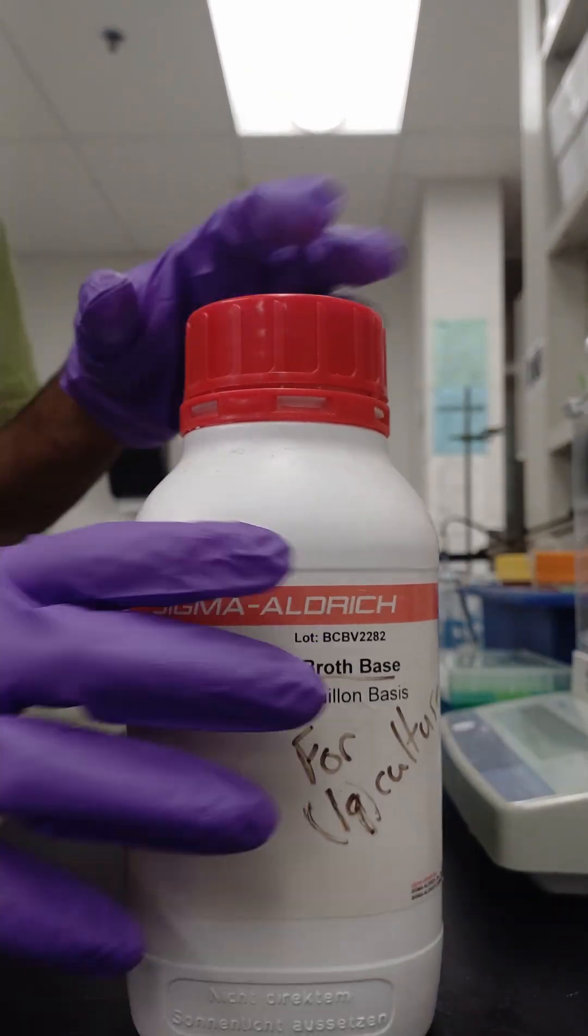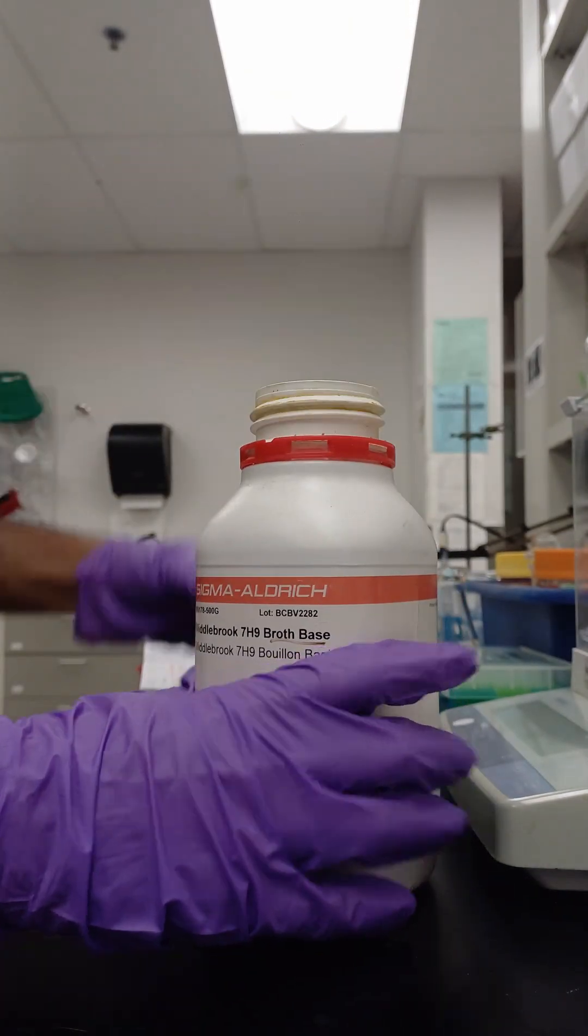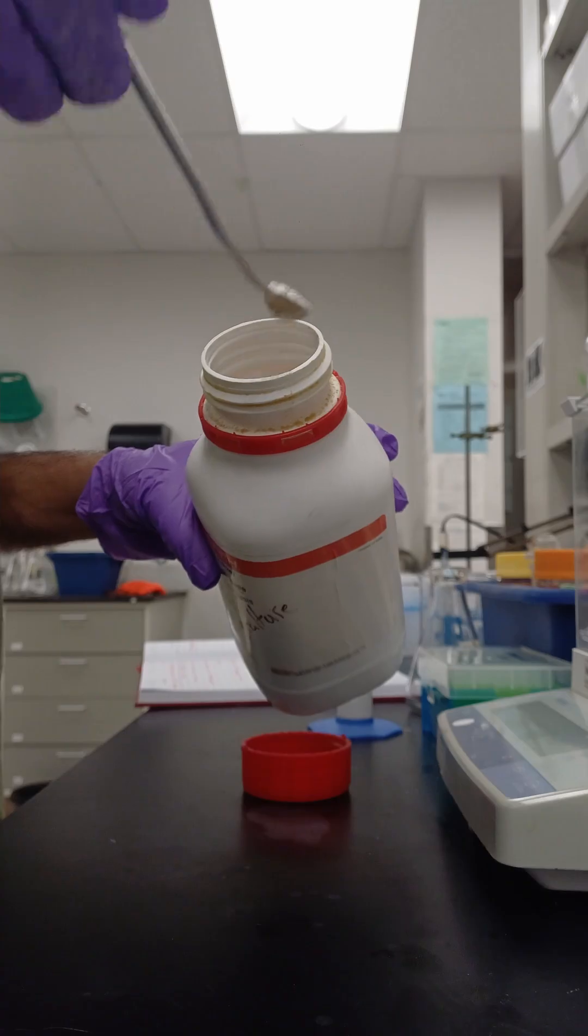This is how I prepare media to grow Mycobacterium smegmatis, a non-pathogenic strain of Mycobacterium tuberculosis.